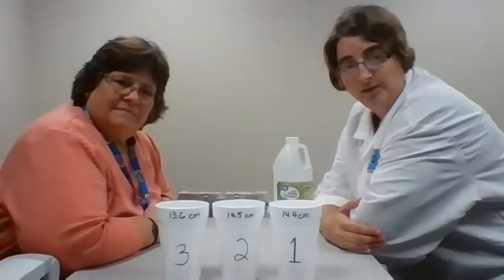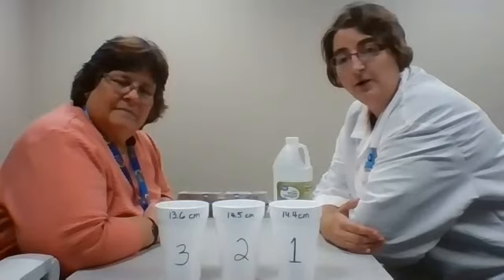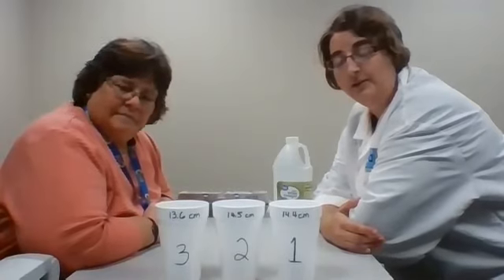So if you are just doing the setup now, that means that you're going to be doing tomorrow's lesson 2 days from now, because it takes 2 days for the vinegar to completely soak through the eggshell.